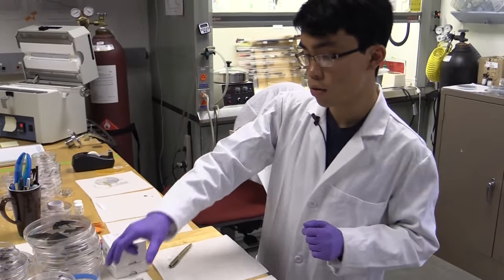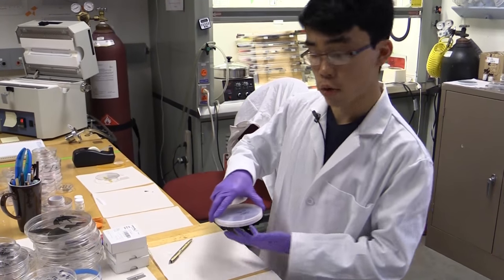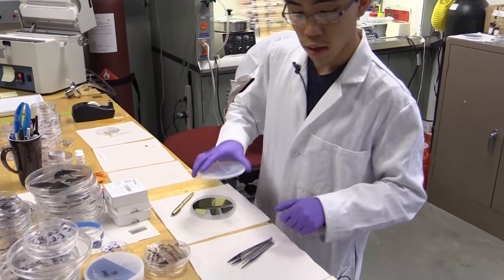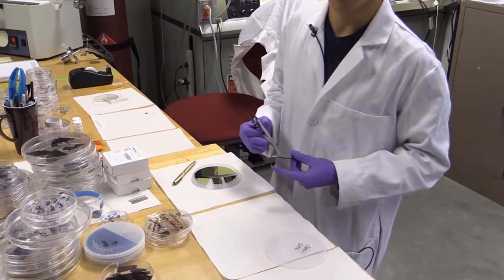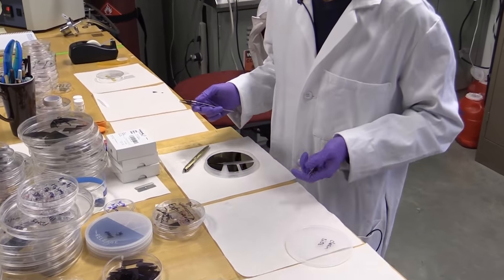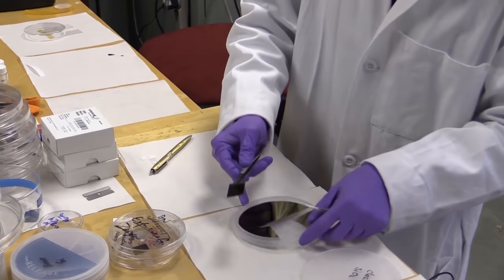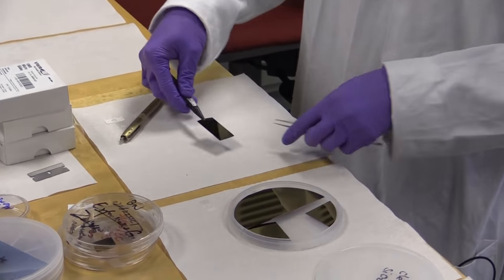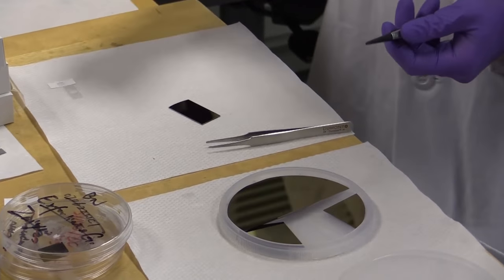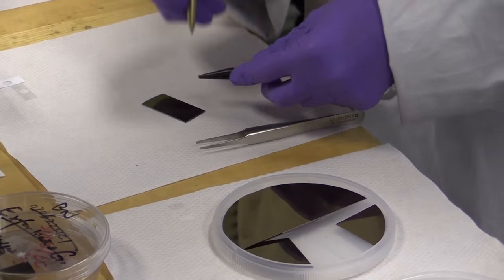Now we are just going to break down some silicon oxide, which we are going to use as our substrate. In principle, we could have pretty much as long of a chip as we want, since we have our nice uniform temperature. However, for testing purposes, I am just going to use a short segment.